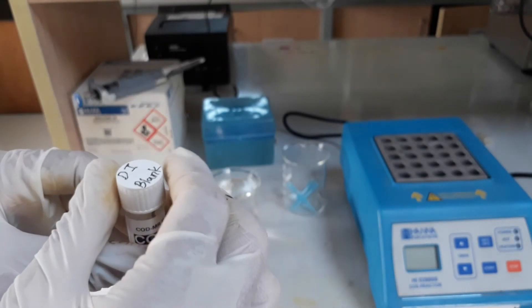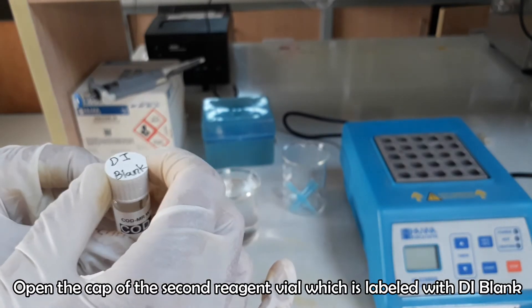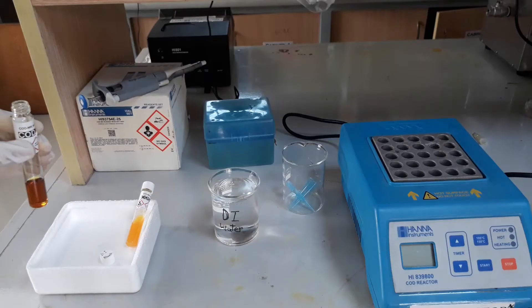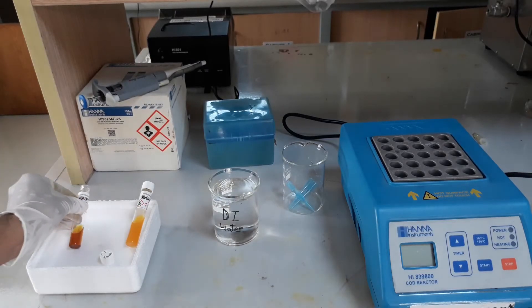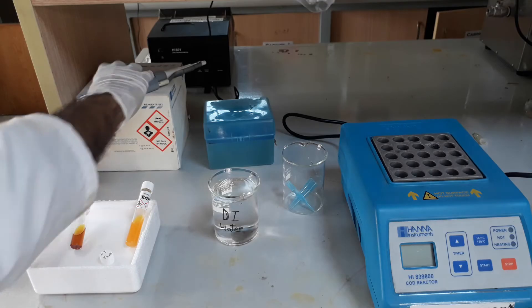Now it's time to prepare the blank with the second vial. Prepare the blank in the same way as the sample was prepared, except mix two milliliters of deionized water with the reagent in the vial instead of sample.